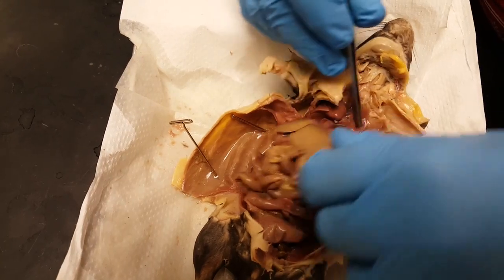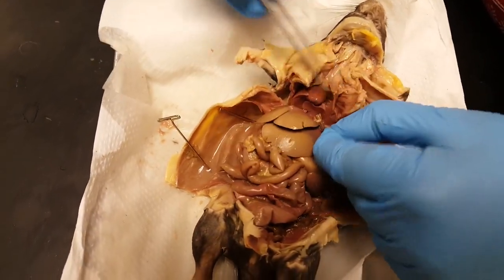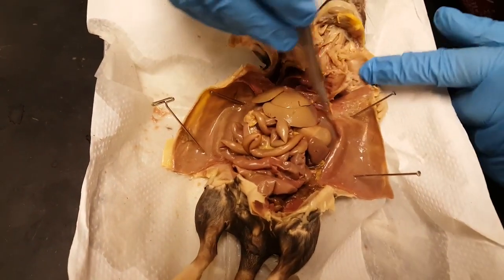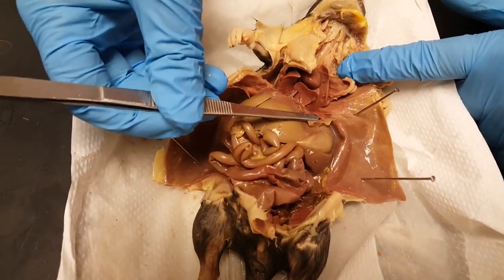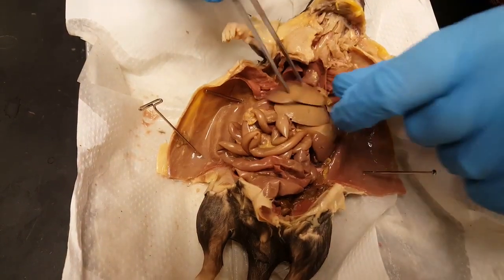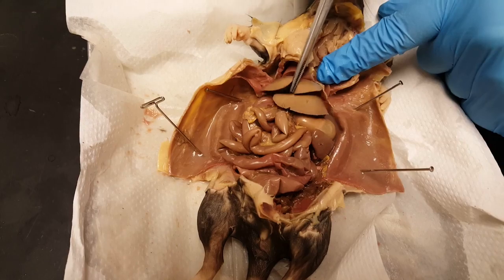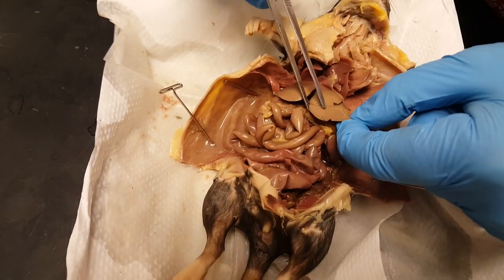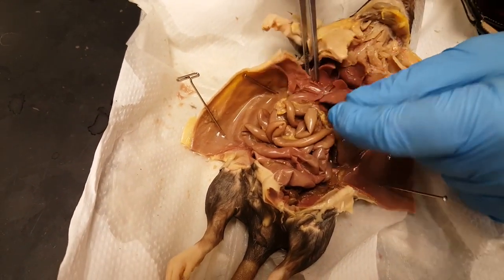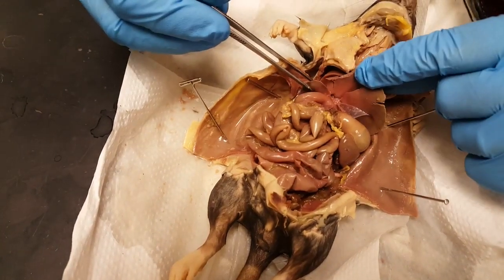Here, between the thoracic cavity — which is like the chest cavity — and the abdominal cavity, we have this muscle: that's the diaphragm. And the liver. The front lobe of the liver with this little cleft in it is the median lobe. Then we have the left lateral lobe, and then on this side is the right lateral lobe.